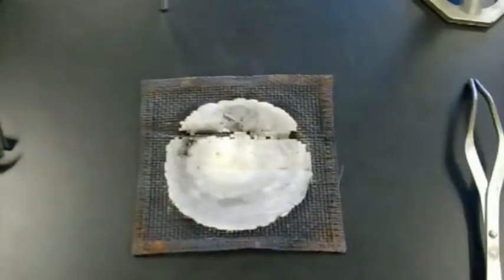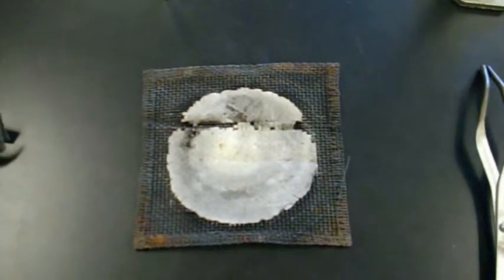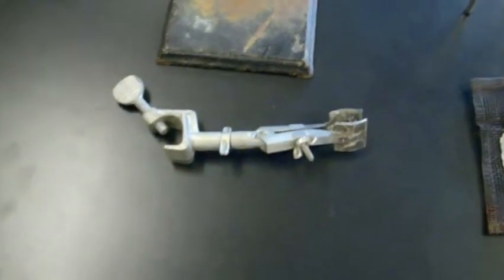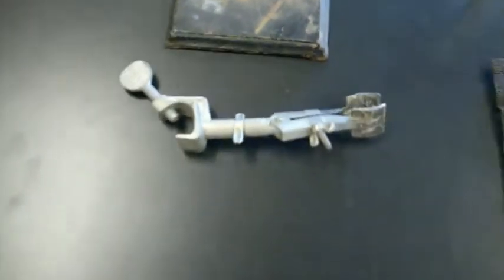a piece of copper mesh or copper gauze, a tripod, a laboratory stand, and some sort of accessory for the laboratory stand, either a test tube clamp like this one or a ring clamp.